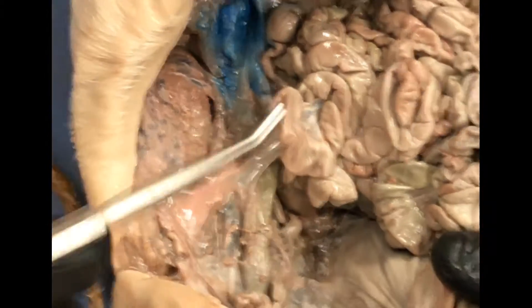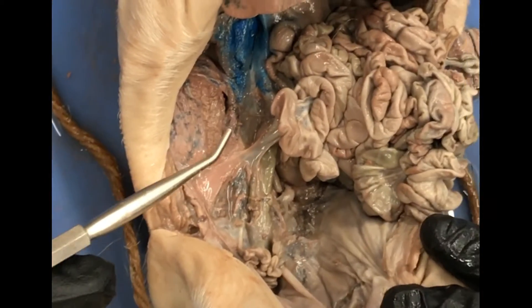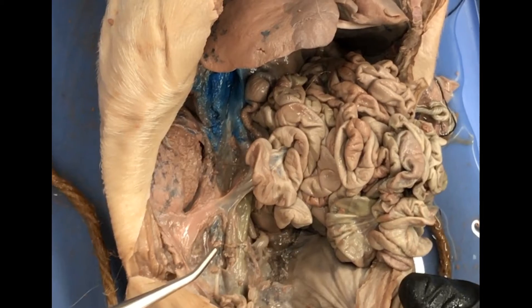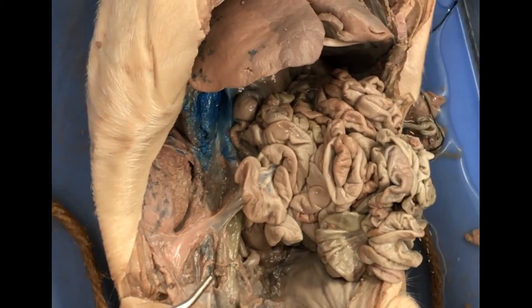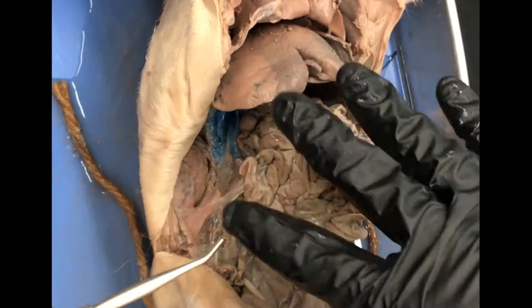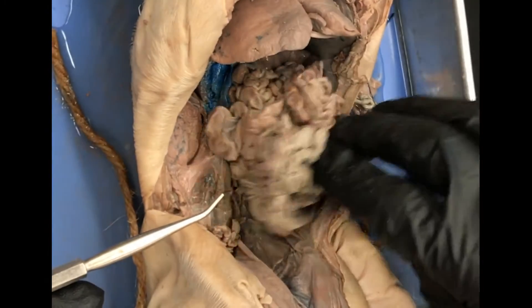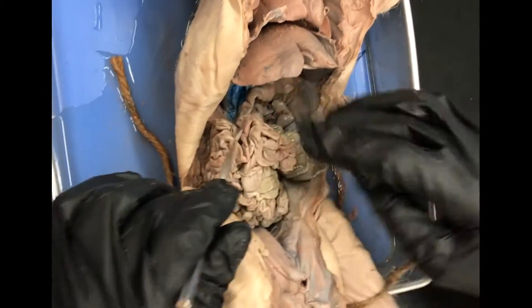Is there anything on your list that I missed? Keep in mind there's a left and right version of all of those things. The divisions of the large intestine you're not going to have to identify on the fetal pig — those are what you're going to do in the illustrations and the cadaver photos. I showed you how to identify the divisions of the small intestine.